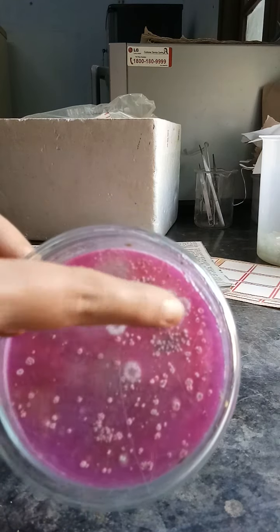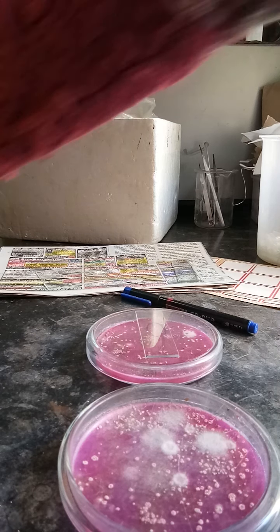Now we are going to use a specific type of solution called lacto phenol solution. In this solution we have added lactic acid, phenol crystals, and also a cotton blue dye which gives blue color to the solution. This solution is used for separation and proper staining of the fungal mycelia.